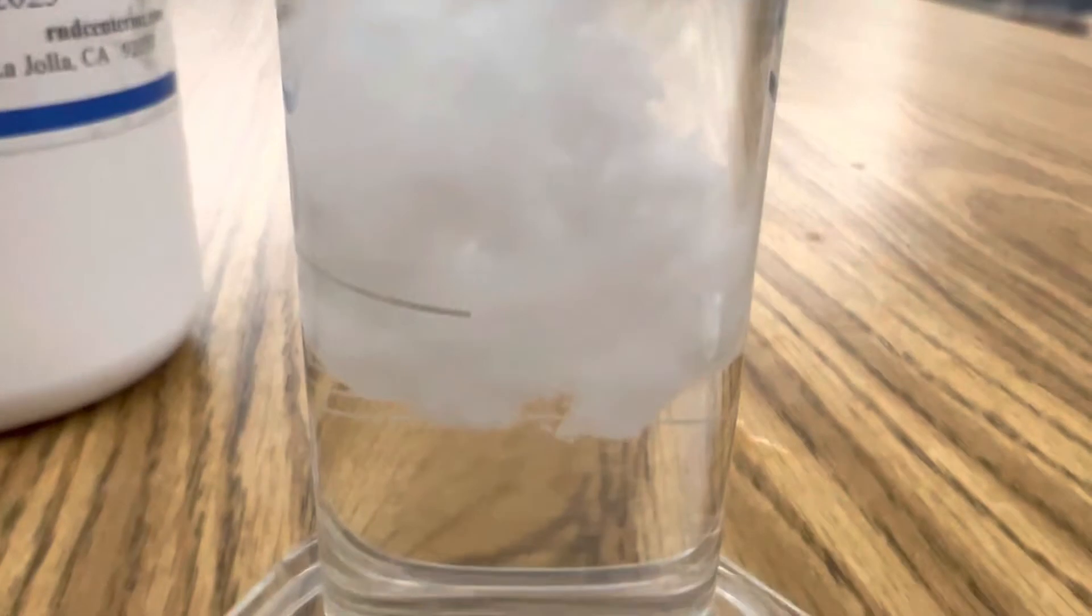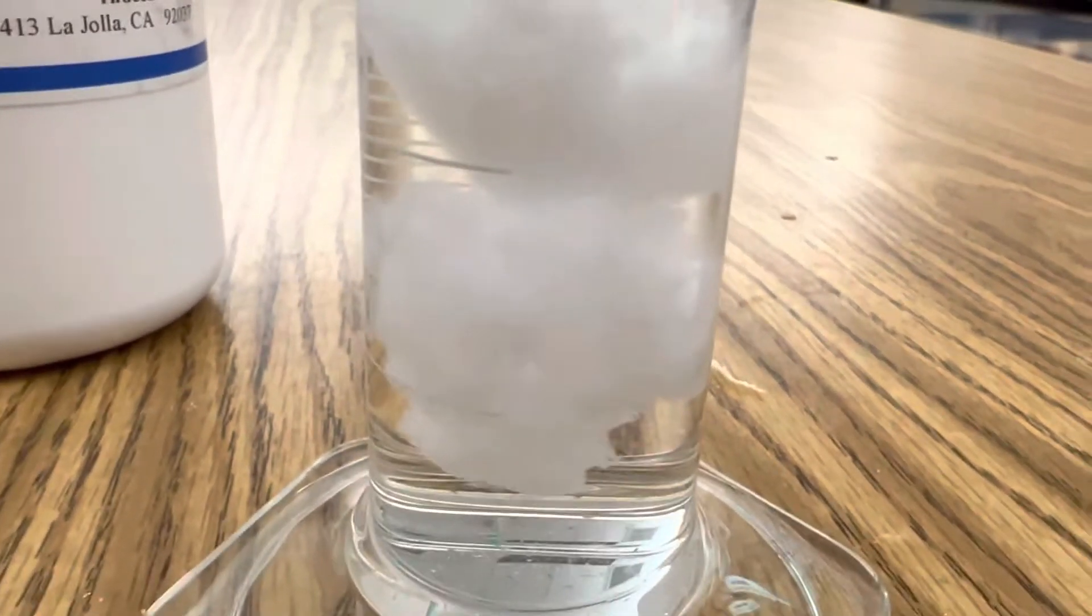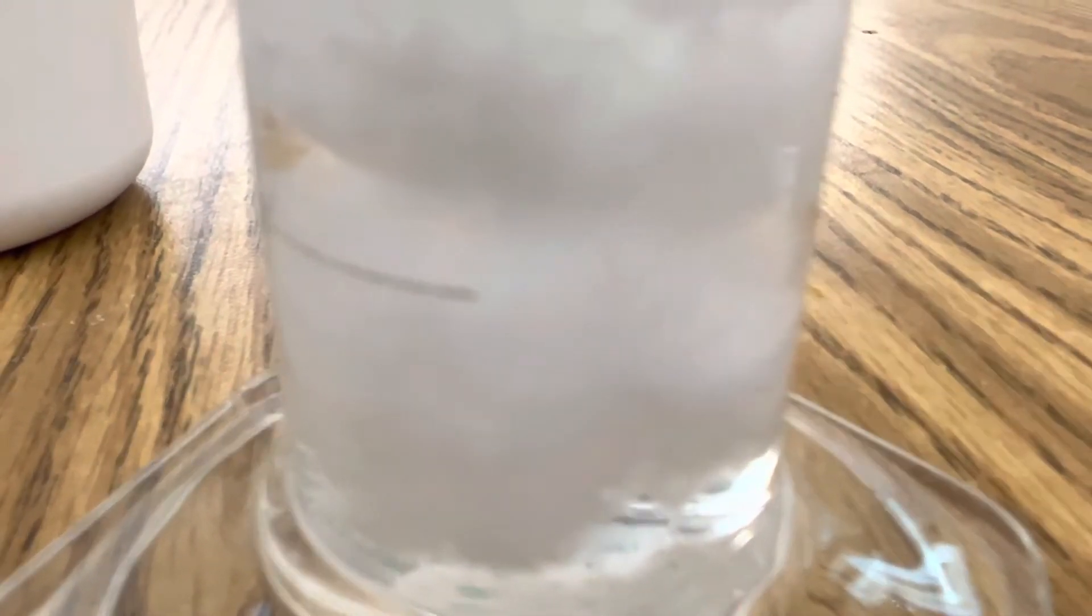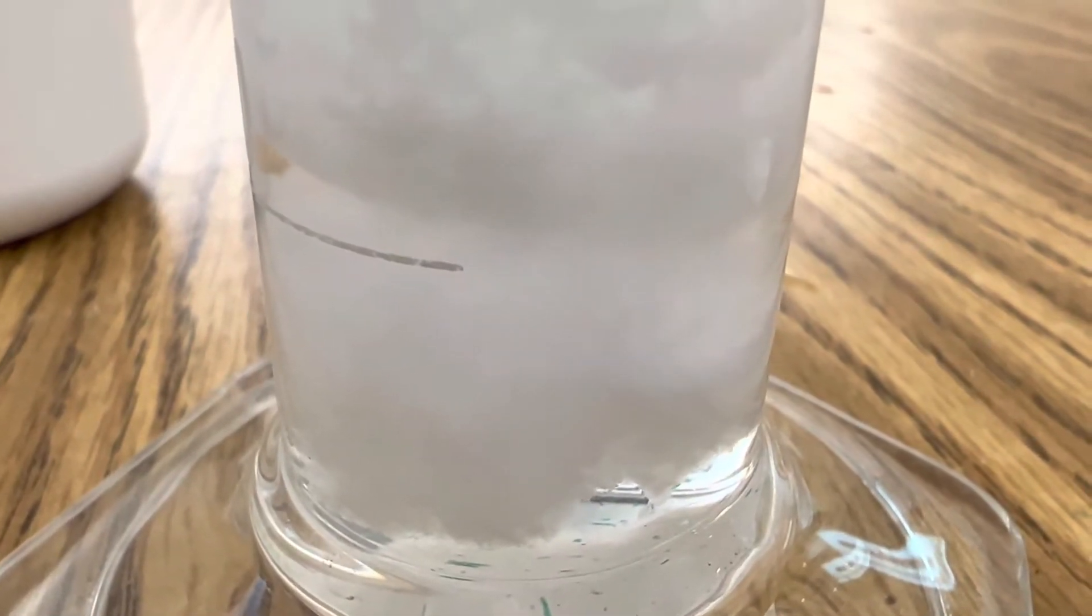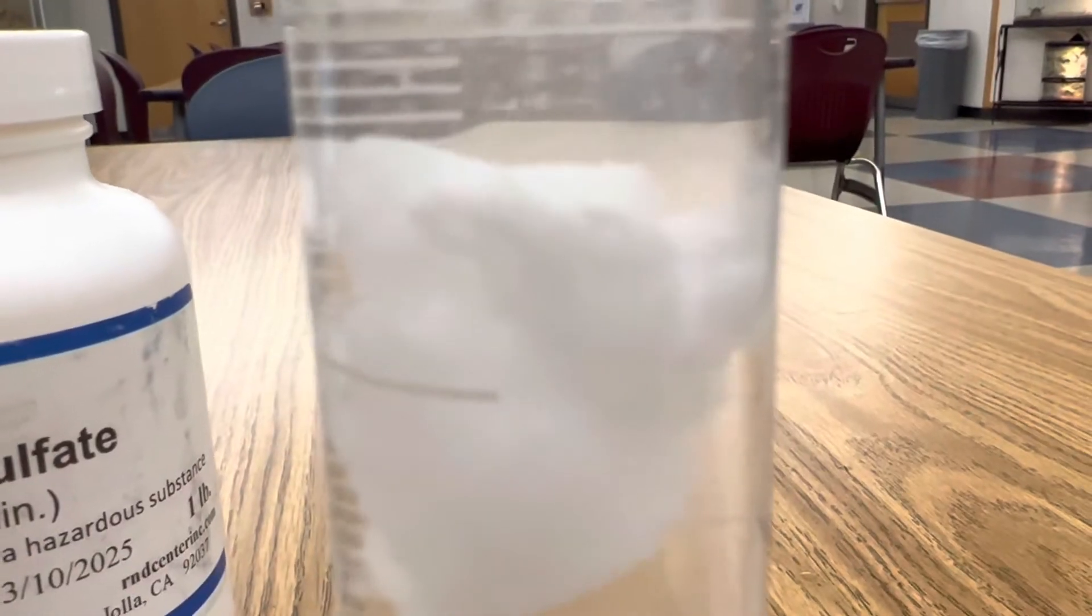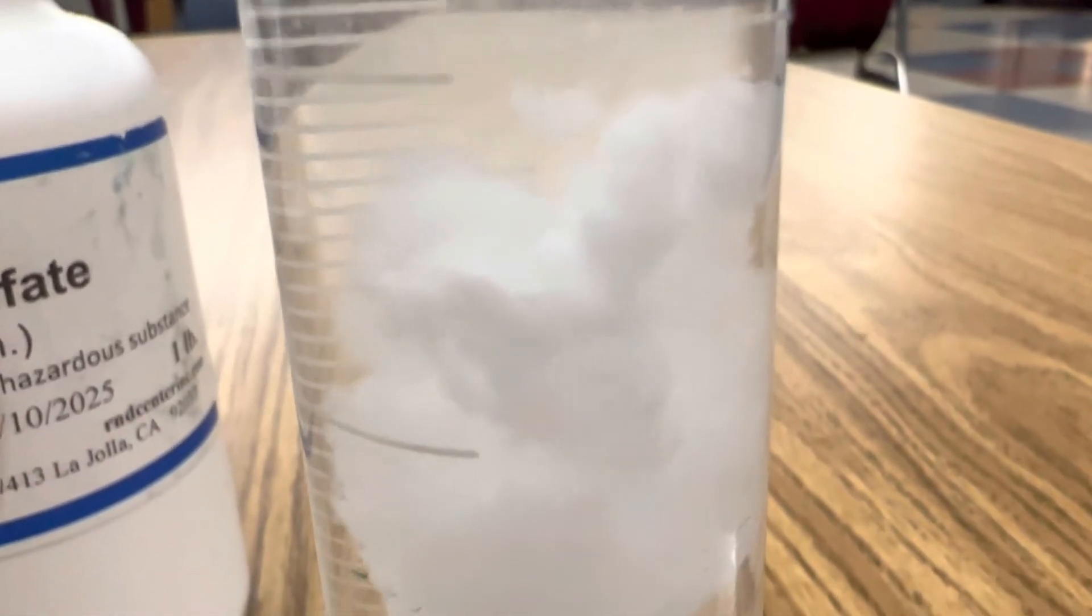Look how slowly it permeates the entire solution. It's almost like a descending cloud. Just amazing. That is strontium sulfate. Here's another huge chunk breaking apart. Look at that.